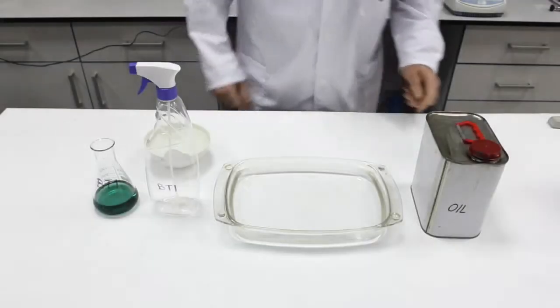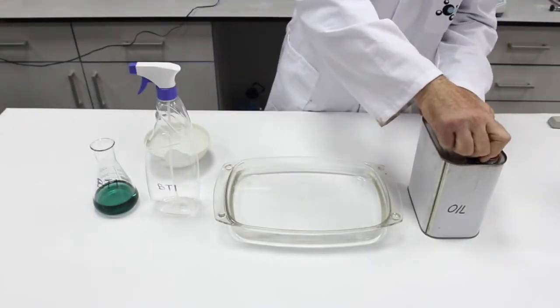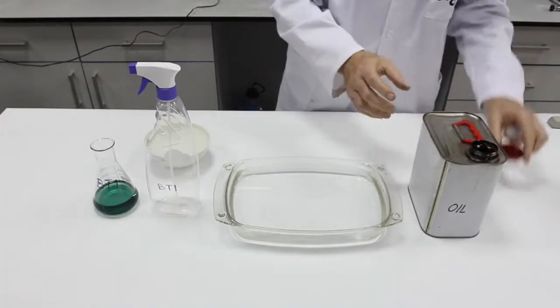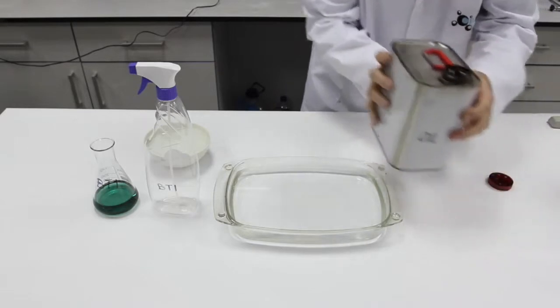You are watching a lab video that will recreate a crude oil spill in a marine environment. By introducing OilFlux BTI Cleaner, you can see how quickly crude oil is recuperated, without adversely impacting the site.